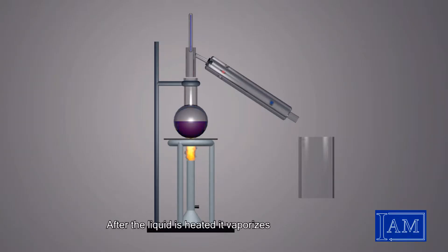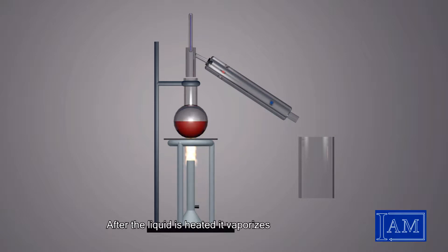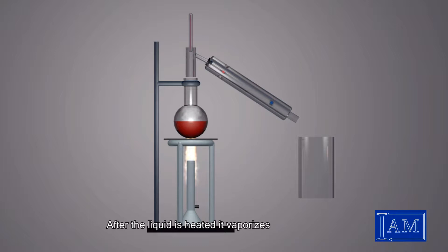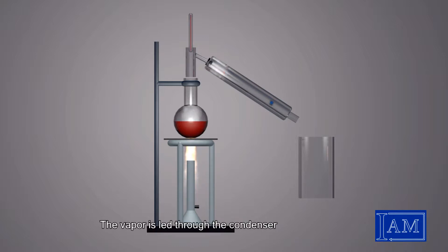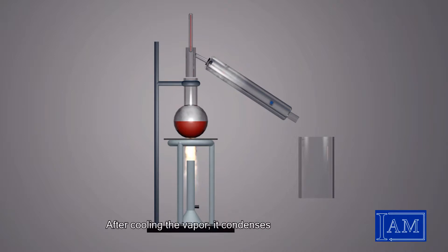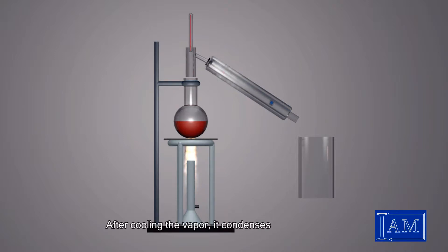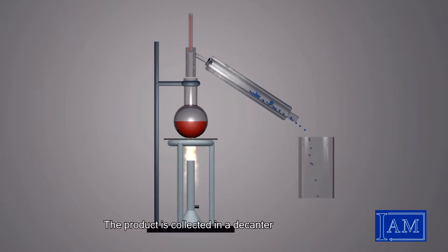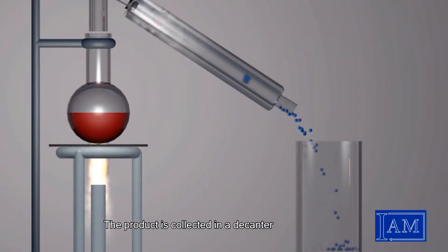First we need to heat the liquid — it will vaporize. The vapor is let through the condenser. After cooling, the vapor condenses and we collect the product in the decanter, as you can see.